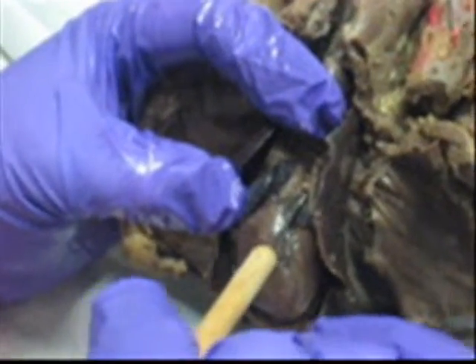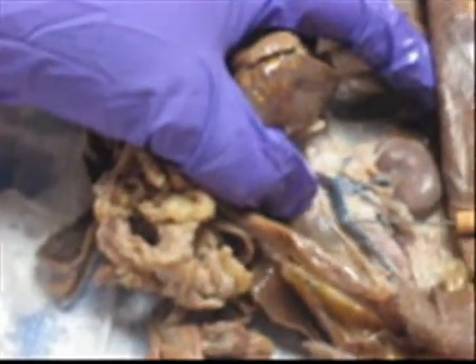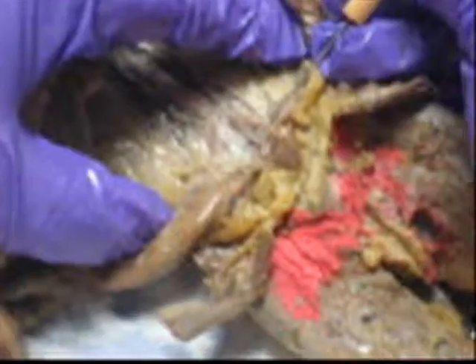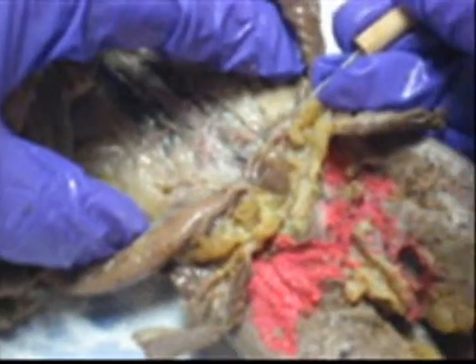Superior vena cava, ascending aorta, aortic arch, pulmonary trunk. It's not memorizing, it's understanding. And right next to it is abdominal aorta. There's a nice link for this. And in here, the common iliacs, and you can see them. Common iliac artery, common iliac vein.